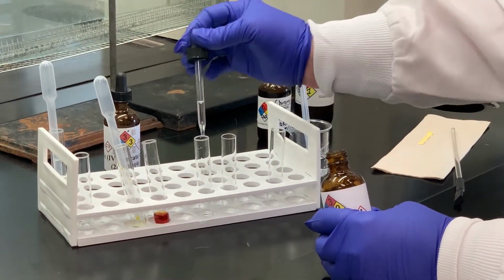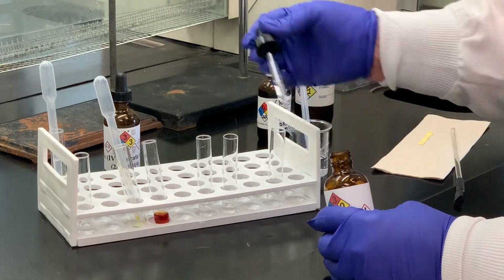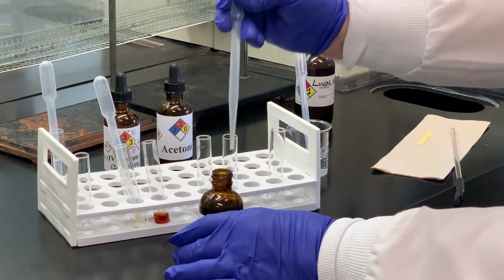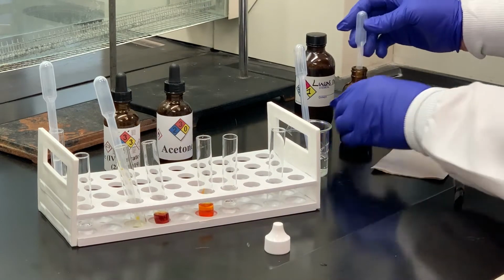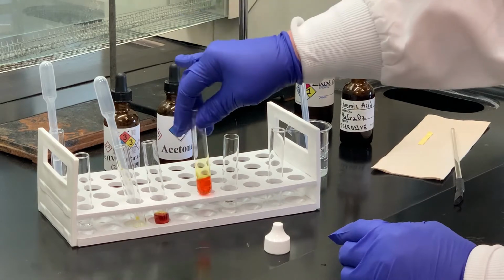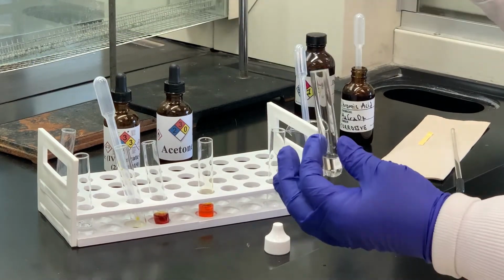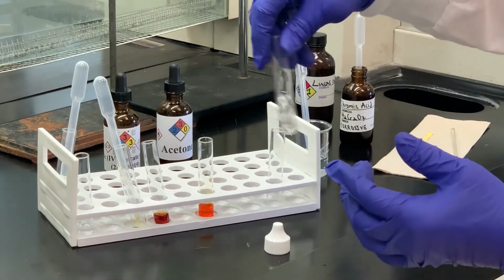And what I'm doing, I like to have a control so that you can see whether it's positive or negative, if there was any change. So all I've done is add acetone, that's the solvent for this next test. And then for the chromic acid, I'm going to add a drop or two into that first test tube, and this is our standard or our blank reference compound. Nothing's happened to it. So now what I want to do is go back. Here's my acetone. I'm going to add a few drops of my sample into the acetone. Make sure everything's mixed.